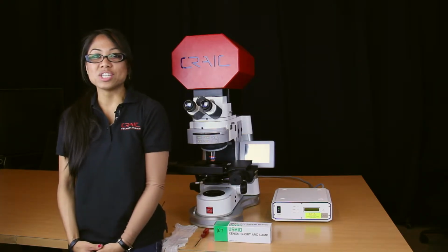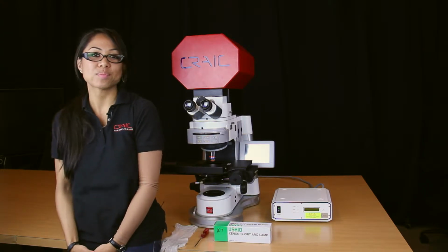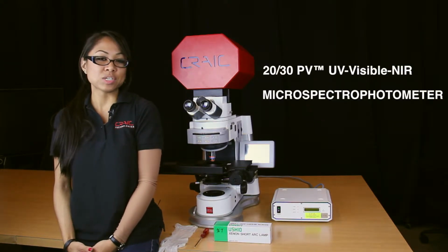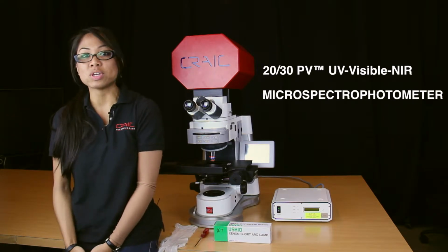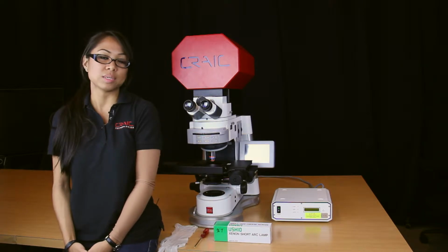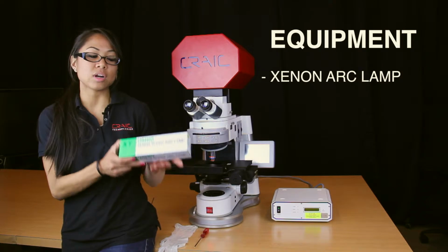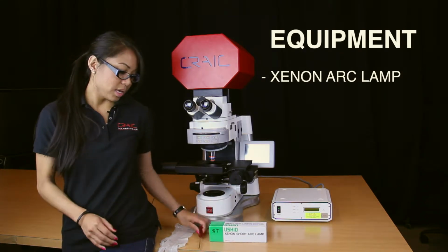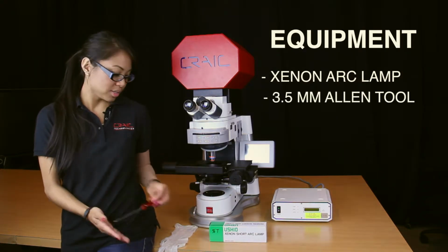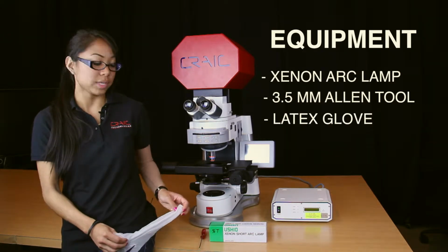Today I'll be showing you how to change your Xenon arc lamp on your UV visible near-infrared microspectrophotometer. We have our 2030 microspectrophotometer. It's currently only equipped with transmission lamp housing, so I'll show you how to only change the transmission lamp housing on the system itself. What you'll need for today is a Xenon short arc lamp, a 3.5 millimeter Allen tool wrench, and a spare latex glove in order to handle the Xenon bulb properly.